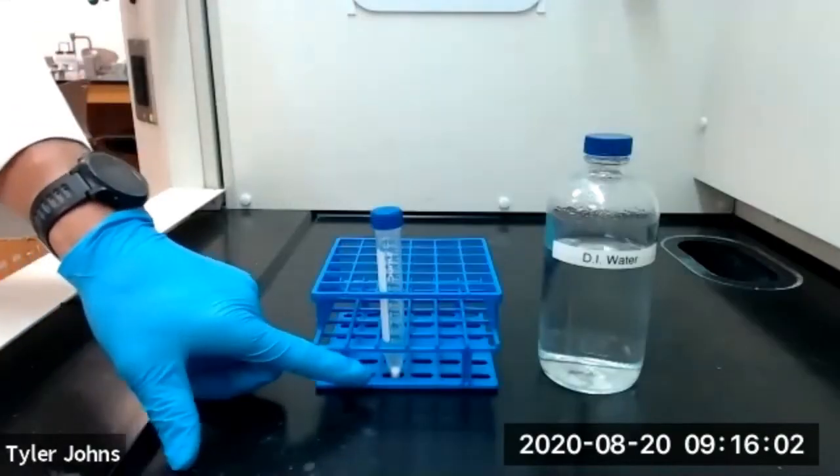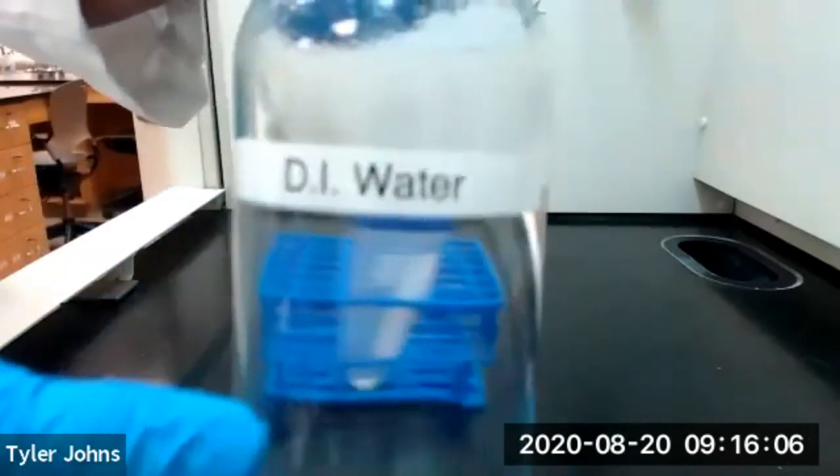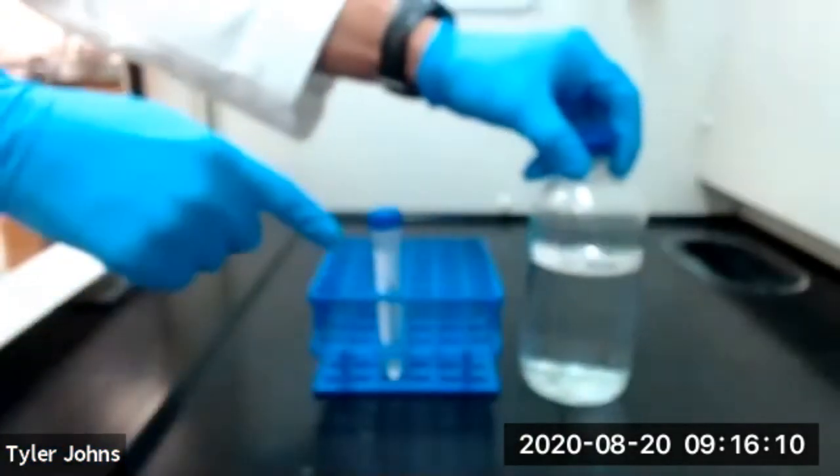I've added our caffeine to the centrifuge tube, so we're now going to add 4.0 milliliters of deionized water to our centrifuge tube.